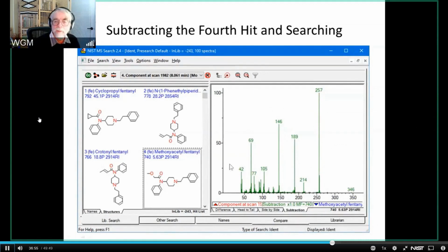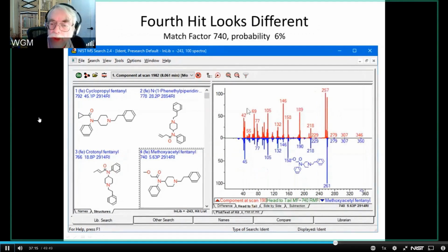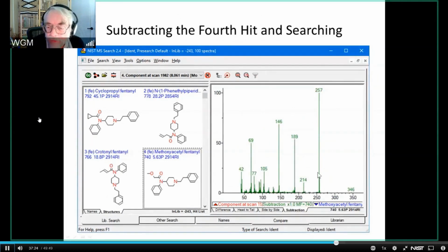This is the spectrum. I'm pointing with my finger, and you can't see that, can you? This is the spectrum that you get from that subtraction. So the spectrum for this molecule was subtracted from the raw data. Right? This is the raw data. This is being subtracted from it. You can see that it's going to take out the 261 and leave the 257.